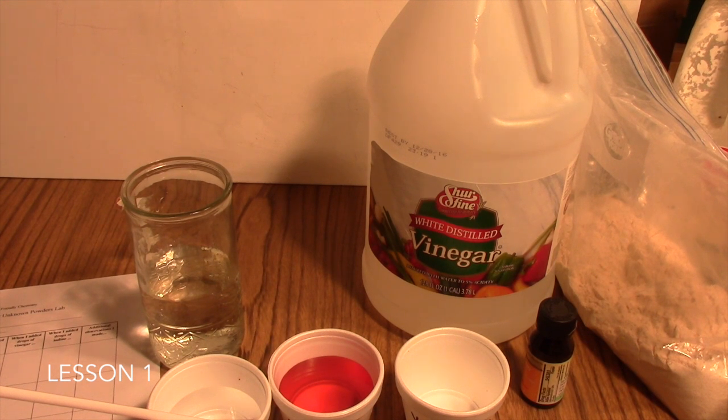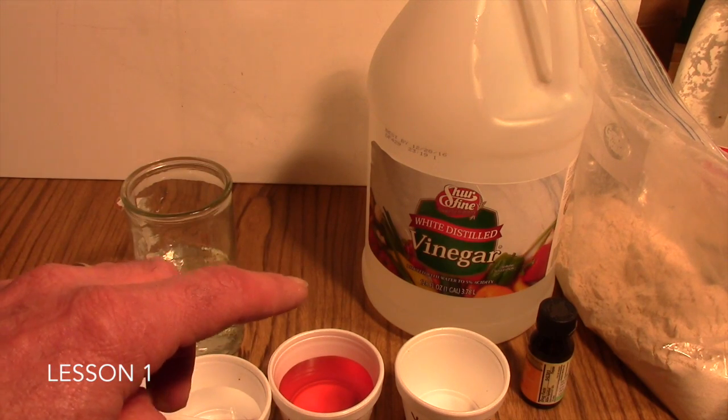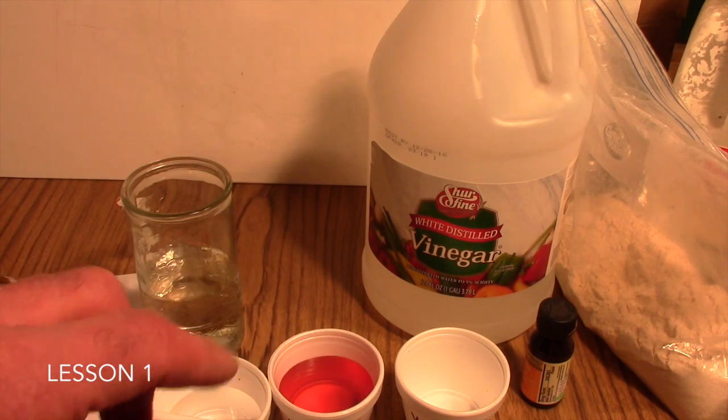Now, as you do get to that point of revealing what the powders are, instead of just saying, well, powder A is this, powder B is this, and close up the lab, the whole idea here is to talk about how we came to the conclusions that powder A was indeed flour and B was sugar, and talk about what were those observations that were the key ones. What made you know for sure that powder A was flour and powder B was sugar? What was the definitive observation?